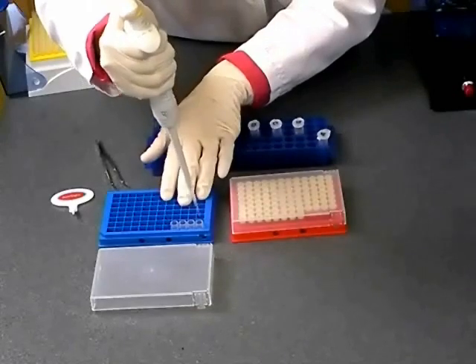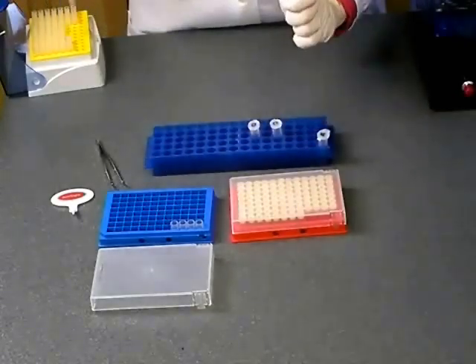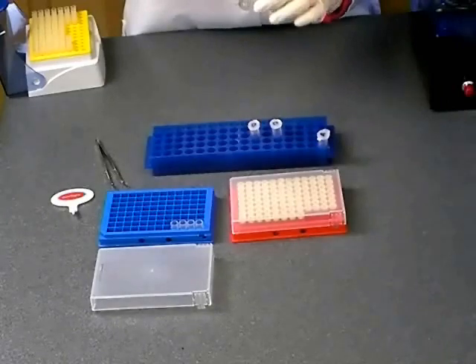Vortexing is not necessary. If necessary, you can centrifuge your rack briefly in a plate centrifuge.